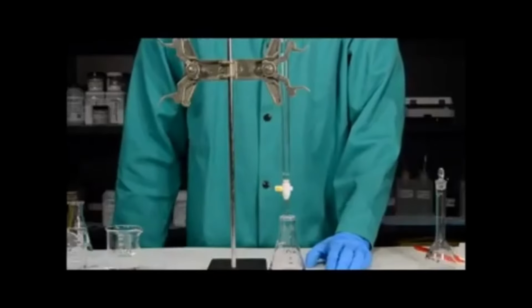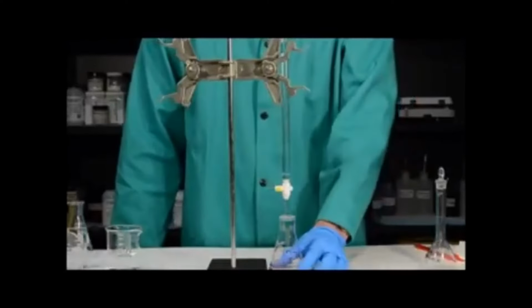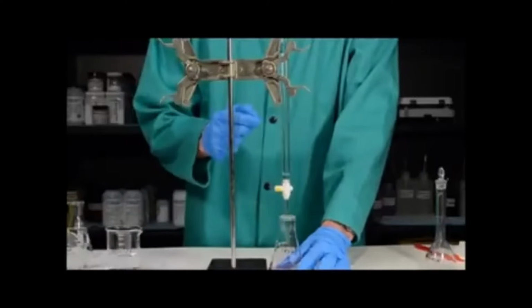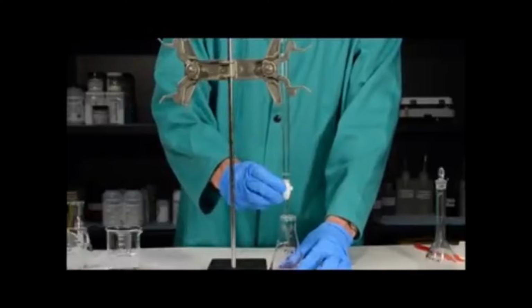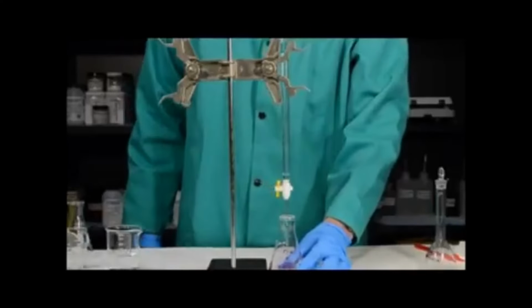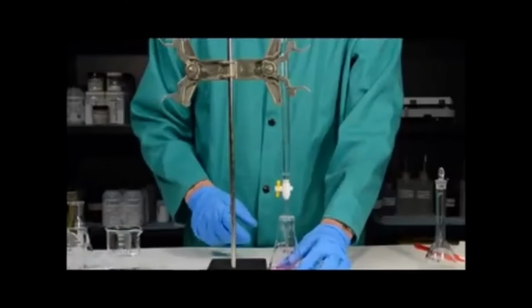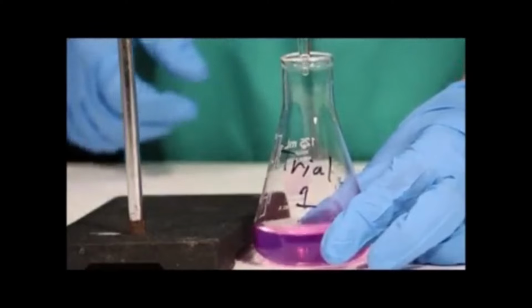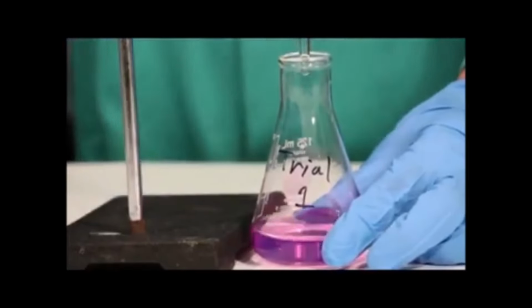There's a couple other things that I would like to show you. The first one is how important it is to make sure that the titration ends at a single drop. Here I'm going to show you what happens if I significantly over titrate the solution. So here I'm adding in 20 or 50 extra drops to show you what happens visually to the solution. You can see here I still have a pink solution. You can't easily visually distinguish this as an over titrated solution.